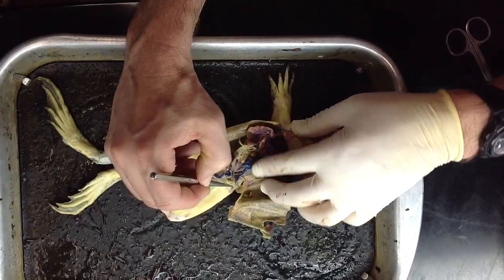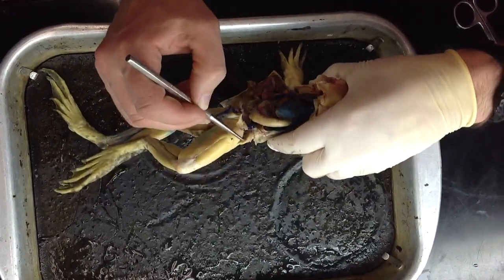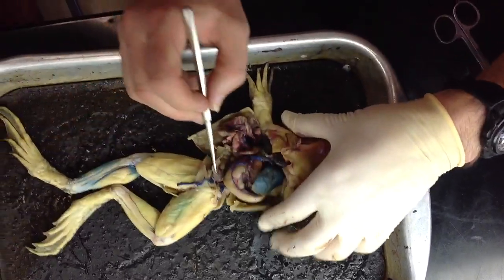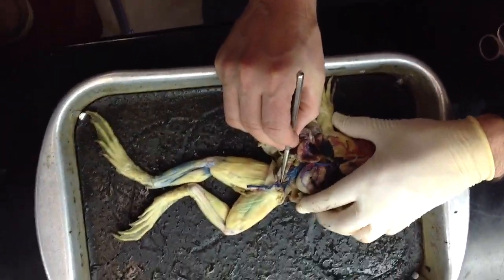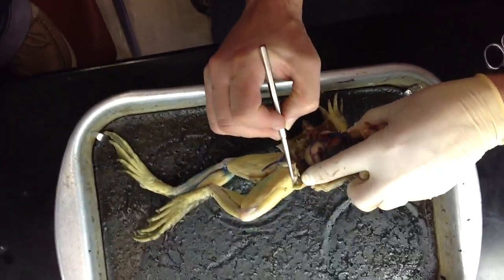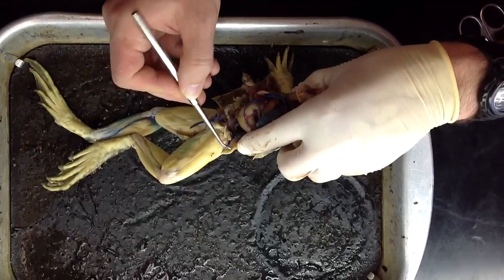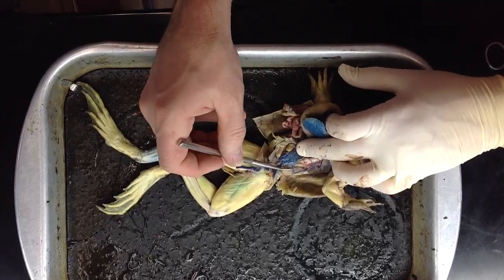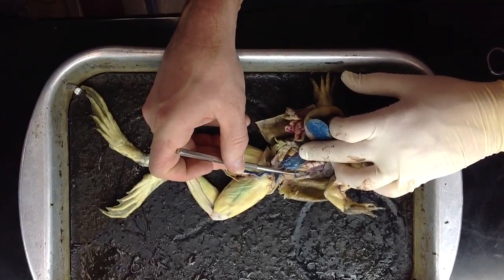And the femoral vein coming from this other direction, I'll rotate that around, which we see coming from the lateral side of the thigh. Sciatic vein comes from the deep part of the thigh. Femoral vein here, more superficial and more lateral. Now the other vein that brings blood into the kidney is a dorsal lumbar vein right here.